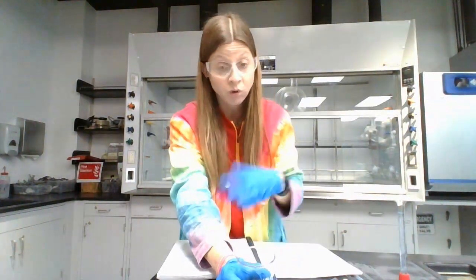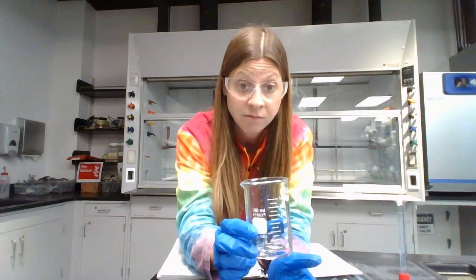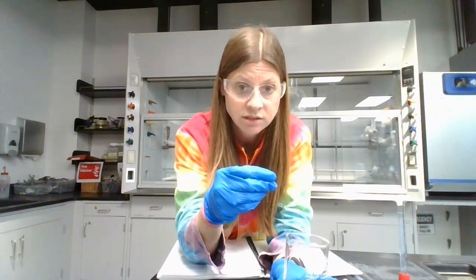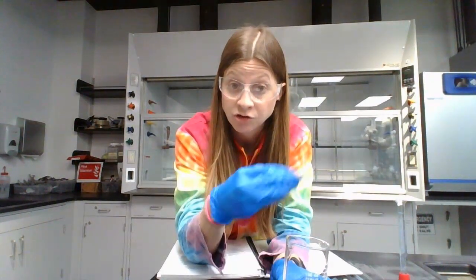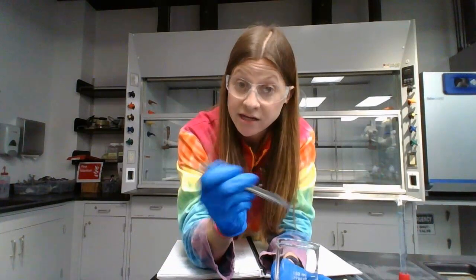Once you know the mass of sodium chloride that is necessary, you're going to take the beaker and set it directly on the balance, close all the doors, and tare the beaker. So the beaker says 0. Then you're going to take a spatula and the sodium chloride provided and add a mass of sodium chloride close to the calculated value for your standard. Then you will close the doors and accurately record the mass of sodium chloride.